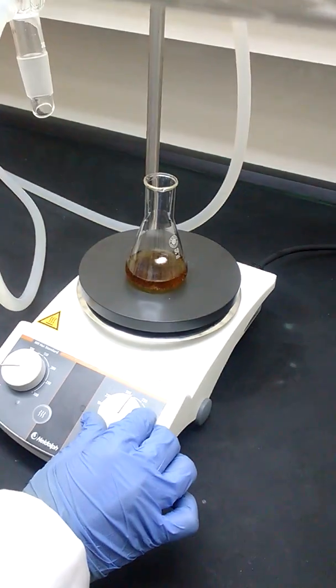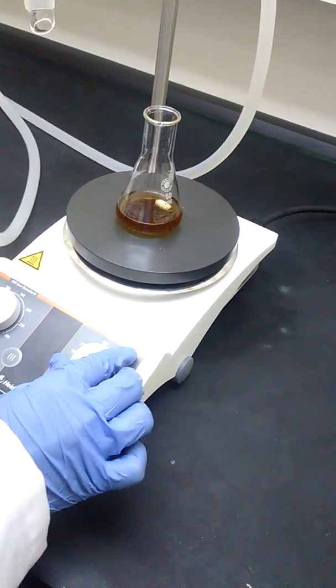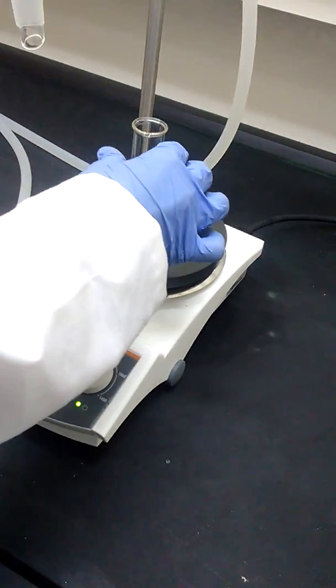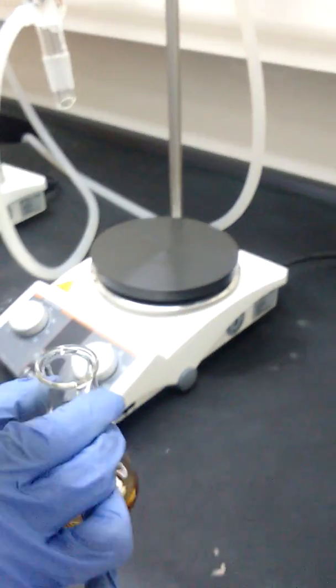Stop stirring after 15 minutes. Filter the solution by using Whatman filter paper.